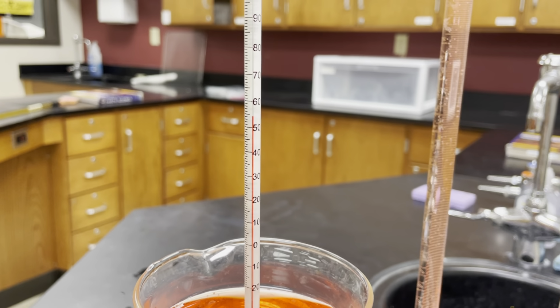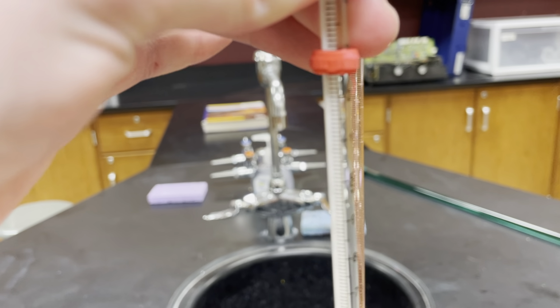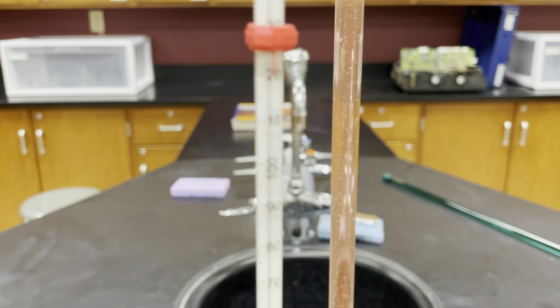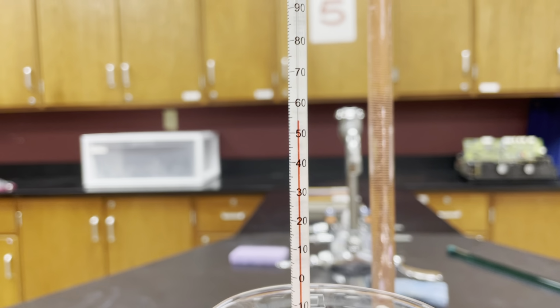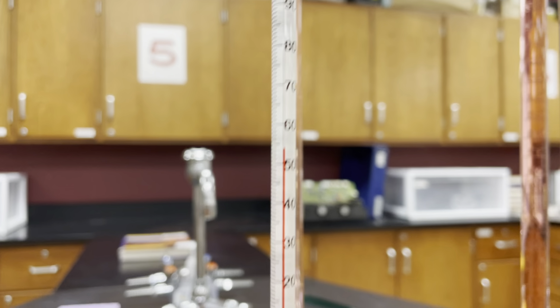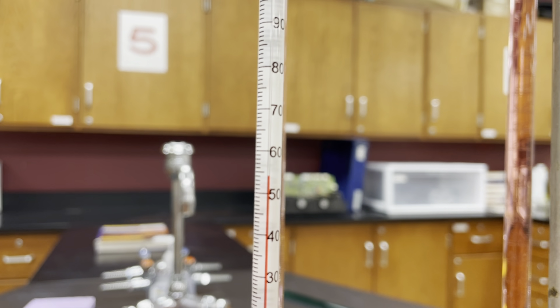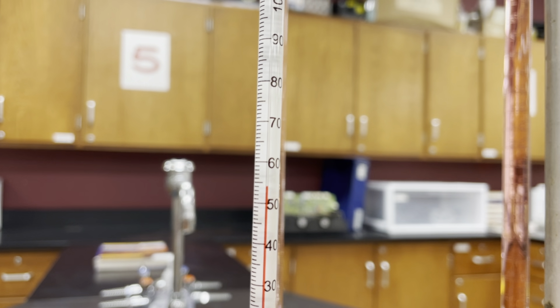So this thermometer here, let me see if I can rotate it a little bit. All right. So this thermometer has some markings on it. This is above the 50 mark, and it's counting upwards. We do have some little demarcations here. Looks like there's 10 of them between 50 and 60, so that's going to be ones places. So right now, this is going above 51, 52, 53. This is sitting at about 54.